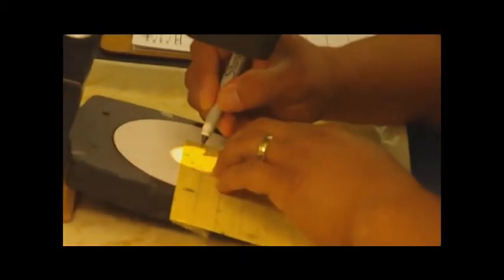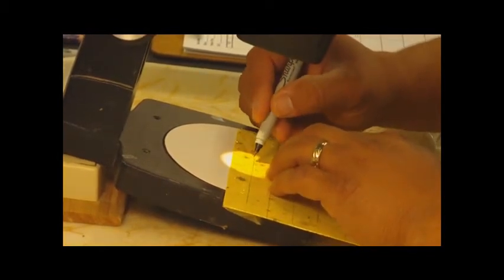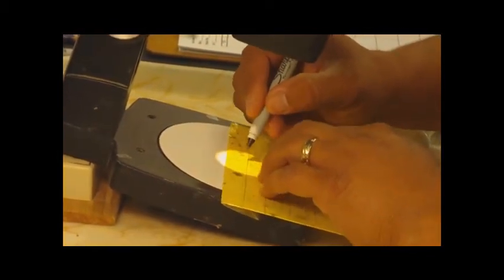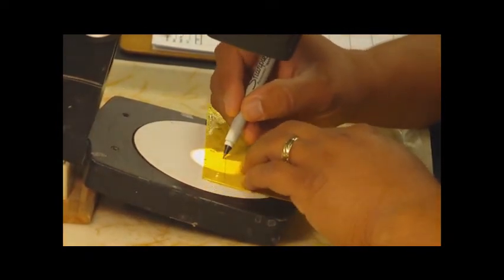And we'll go ahead and make small V-shaped marks for the adults. And then small circles for the thrips larvae.